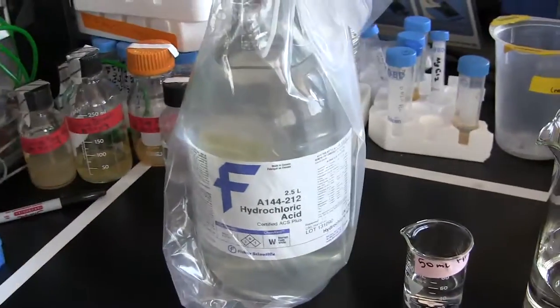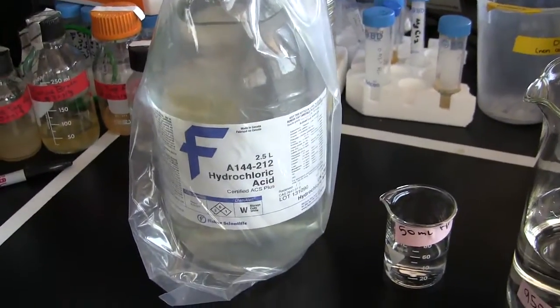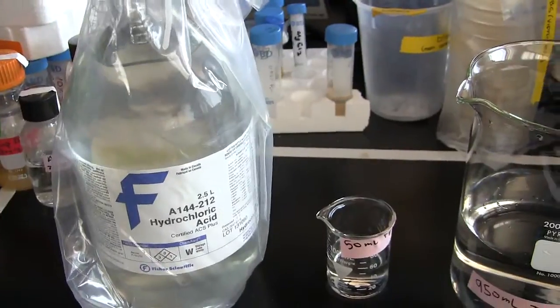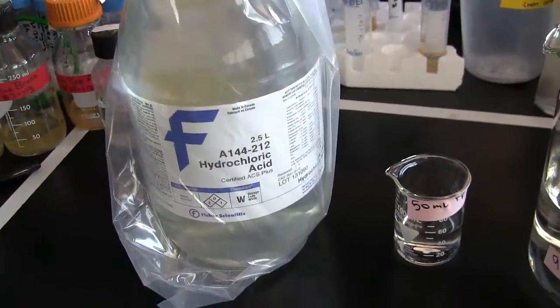To do so, you'll need concentrated hydrochloric acid. Here is a two and a half liter bottle as it comes from the supplier, Fisher in this case.